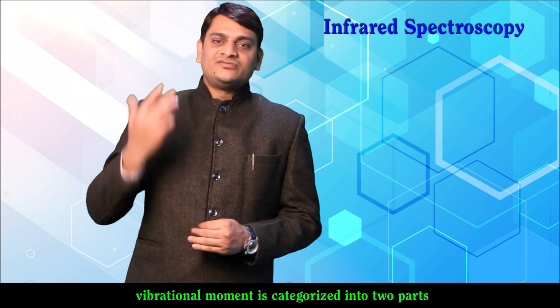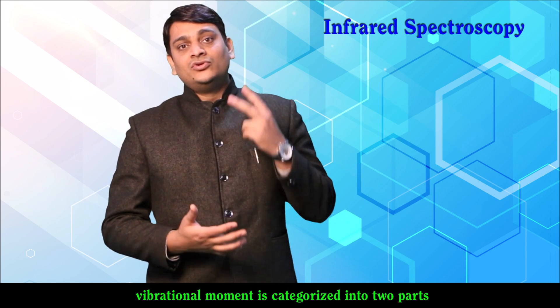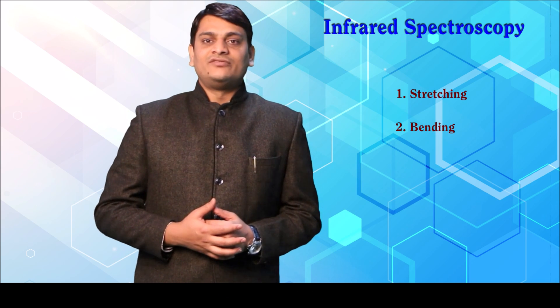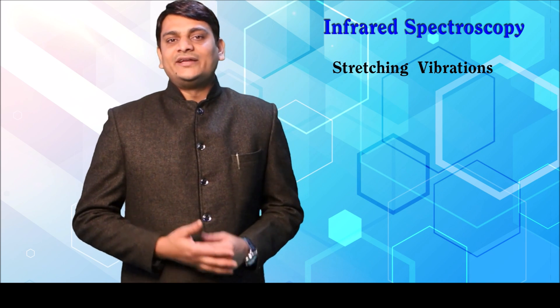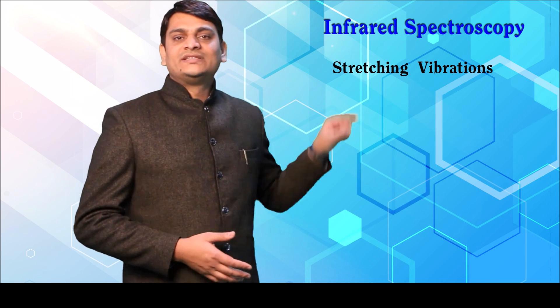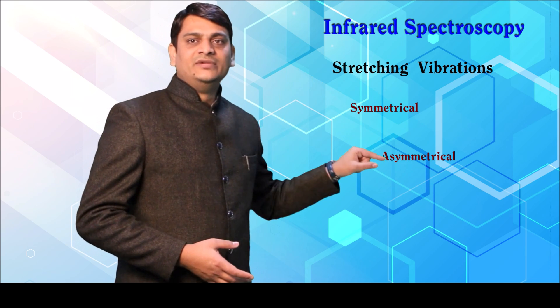This vibrational movement is categorized into two parts: the first one is stretching and the second one is bending. Stretching vibrations are again categorized into two parts: the first one is symmetrical and the second one is asymmetrical.